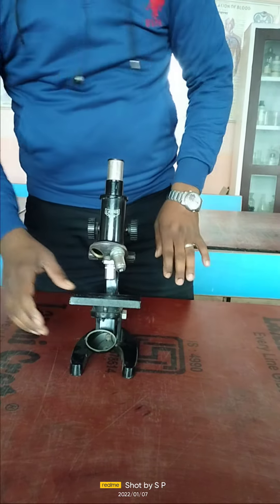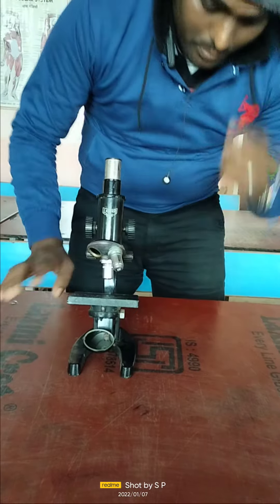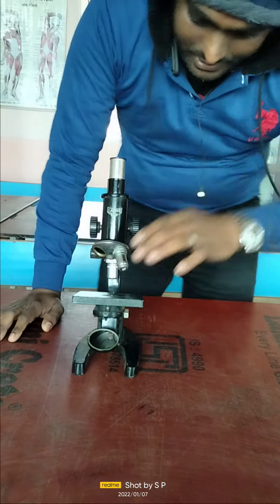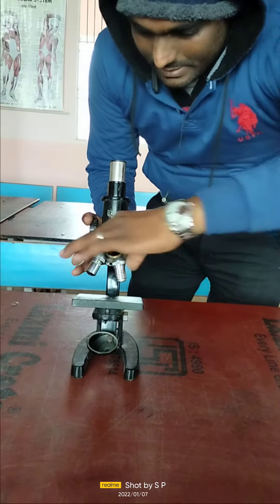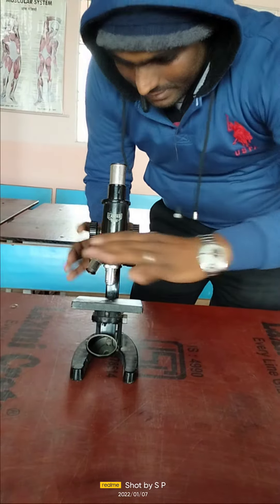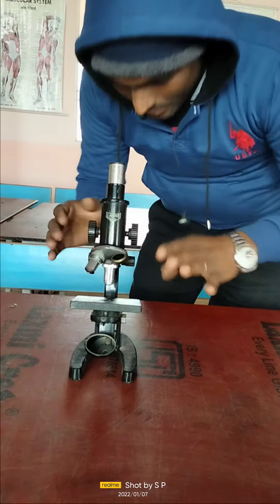We are going to fix the specimen so that it does not move, and after that we are going to fix the eyepiece lens at a proper distance so that the specimen may be clearly observed. In this way we are going to see the specimen with the help of the compound microscope.